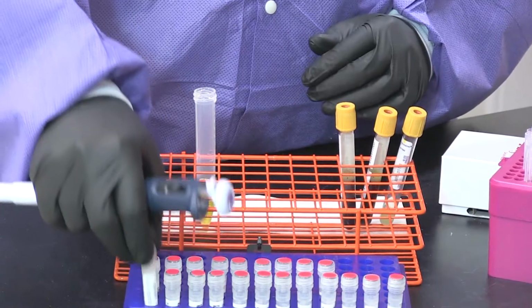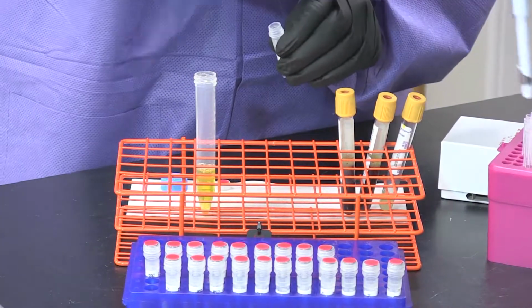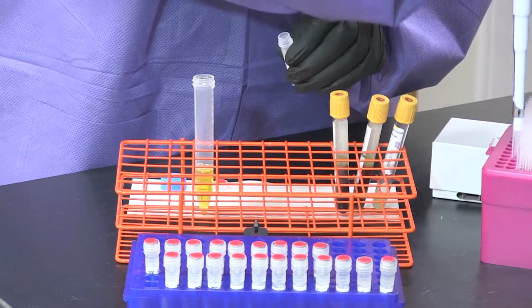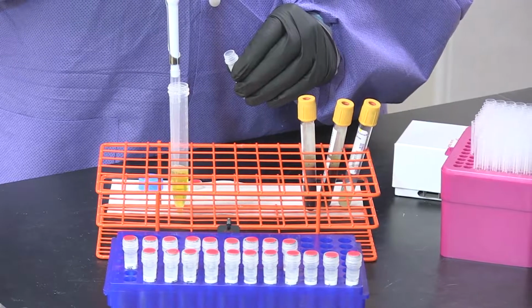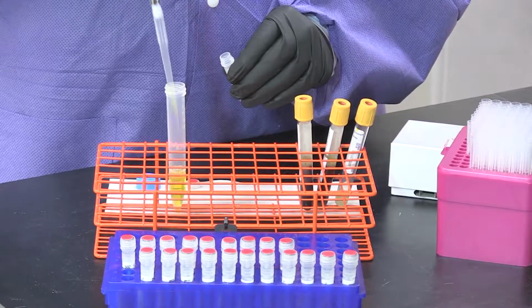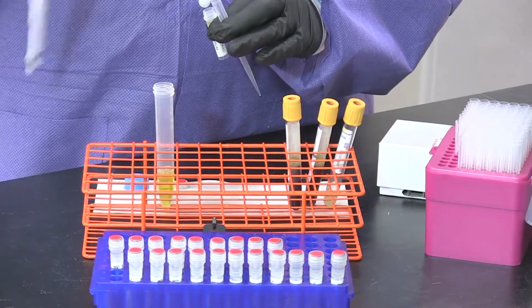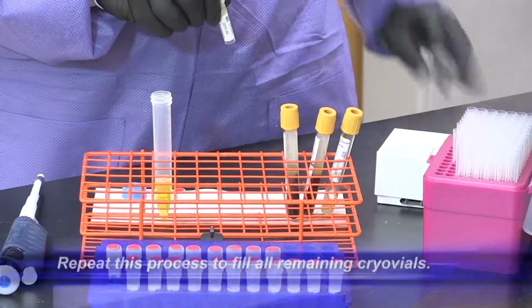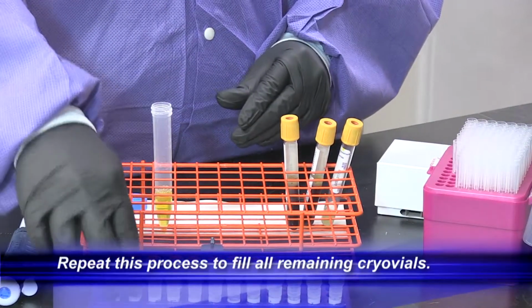Decap your conical tube and your cryo vial. Load the pipette tip onto the pipette and transfer the serum from the conical tube to the cryo vial. You're going to repeat this process for each of the remaining cryo vials.